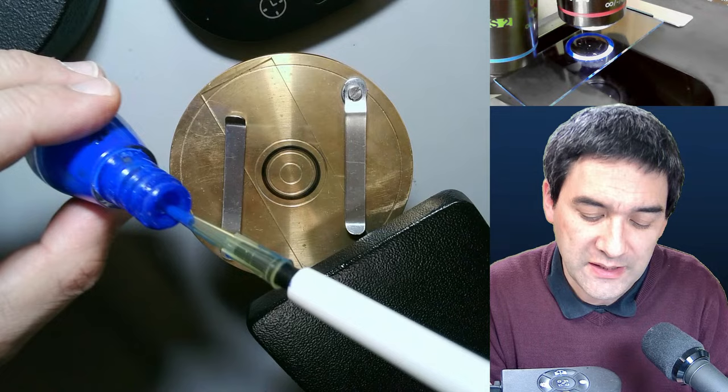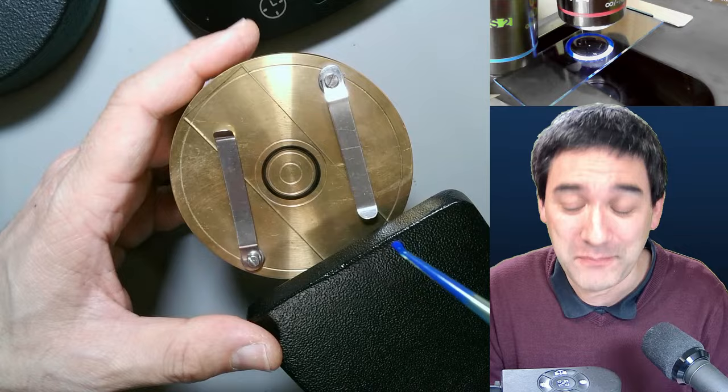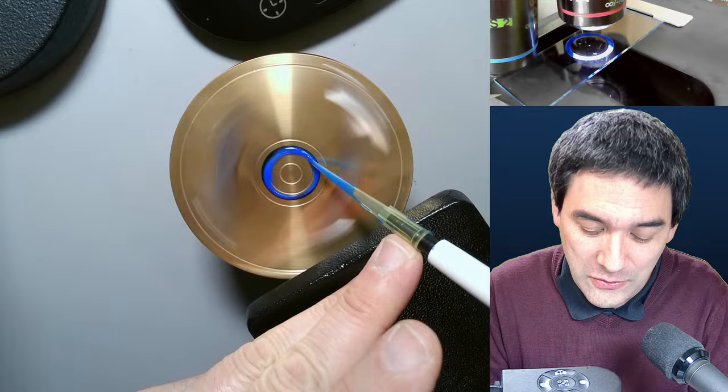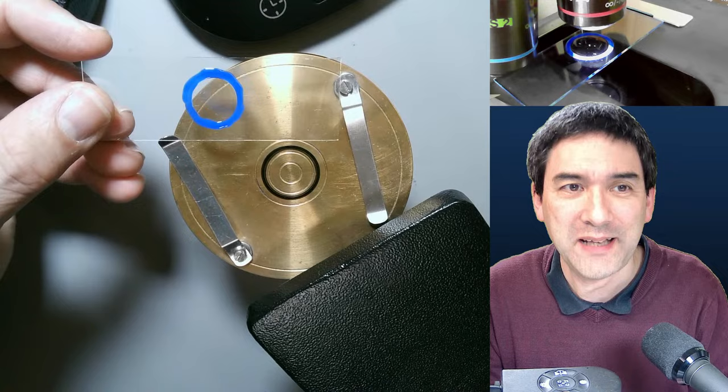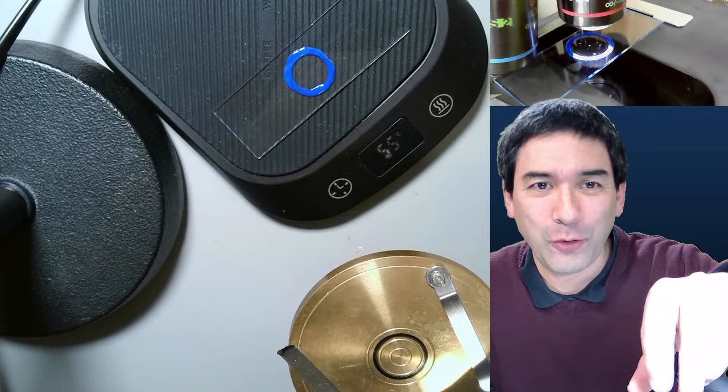You give it a nice spin and carefully apply — and then you've got a nice little ring. I'm going to put it on the coffee warmer now. After about three to five minutes it's going to be dry. I'm going to make a second one now, and then I'll be showing you a couple of homemade tools. If you have any microscopy-related questions, please feel free to ask them in the chat.